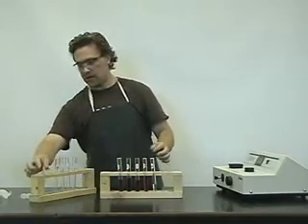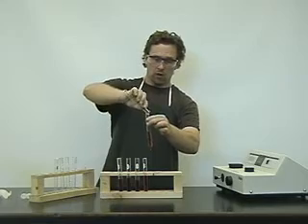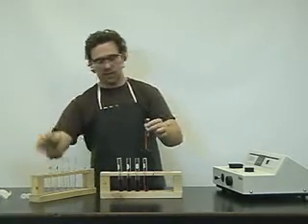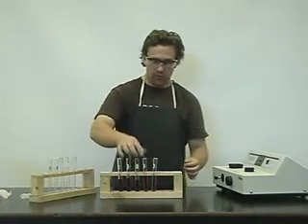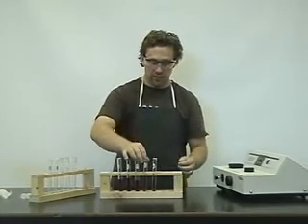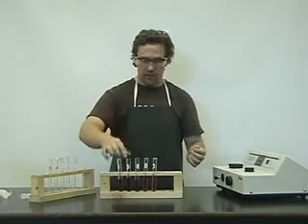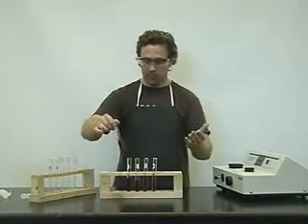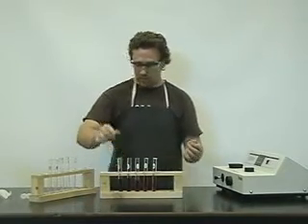Okay, we're almost ready. Once we've got all 5 solutions, we'll give them a nice thorough mixing to make sure they're mixed evenly throughout. Then we're going to take a sample of it, place it into a cuvette, and into the spectrophotometer, and take the absorbance. I'll make that available to you via a table. So let's begin.